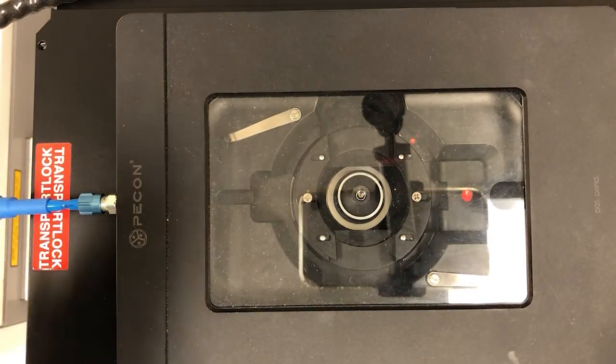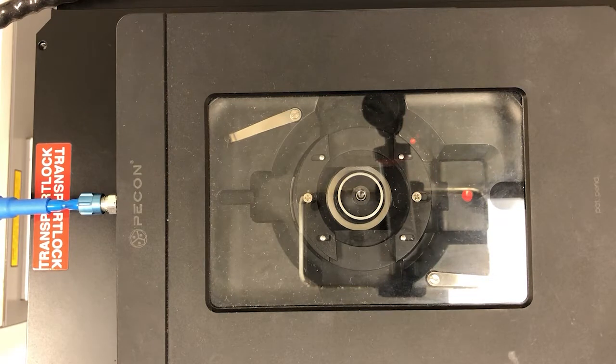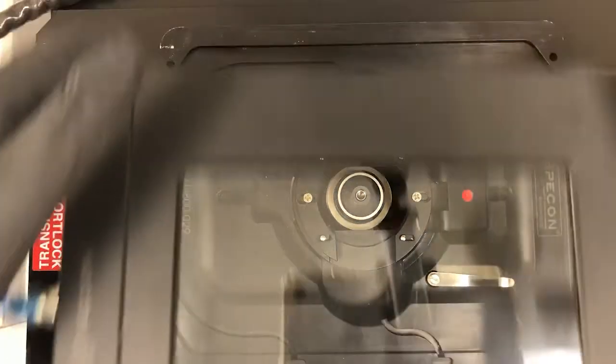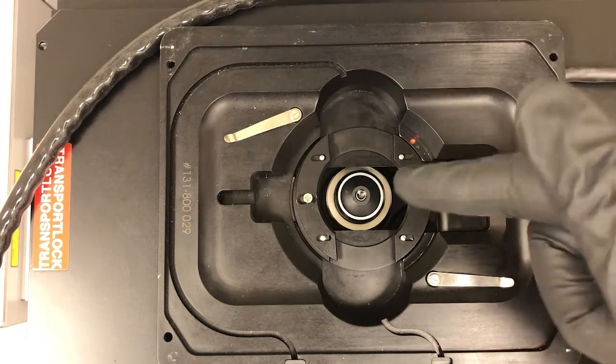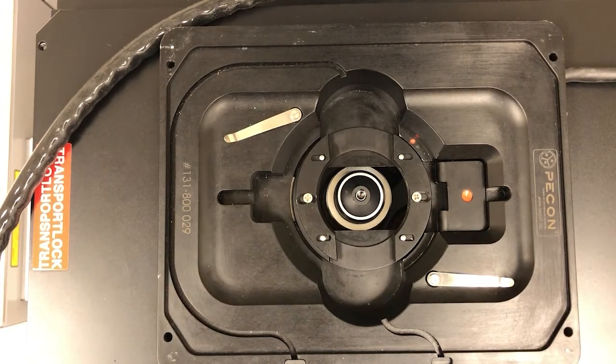It's a good idea to set your sample up first thing so that it has some time to equilibrate, because the change in temperature will cause changes in focus. So it's best to leave it some time to settle down before you actually start your imaging. Another thing to keep in mind is that if you want to use an oil objective, you will need to put the oil objective in position and oil it before you put your sample on. Okay, so that's something to keep in mind if you're going to use a live sample.